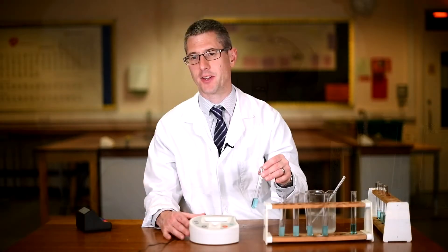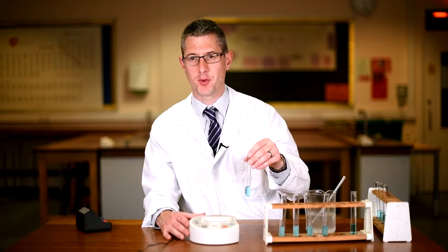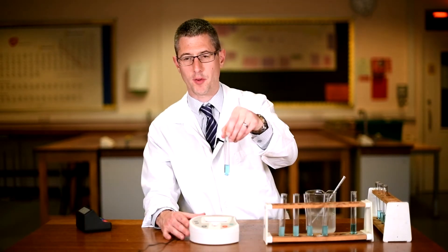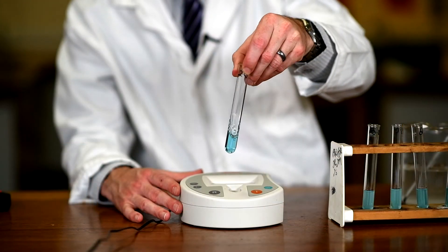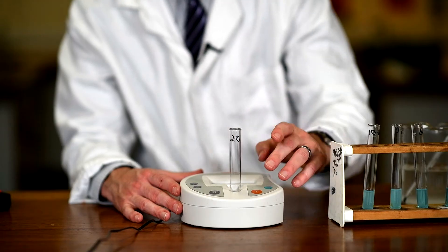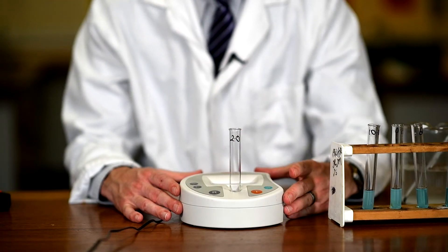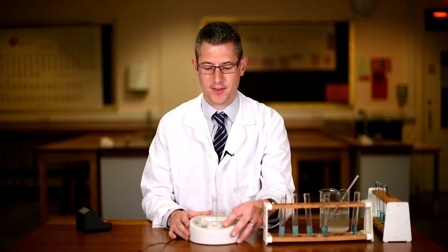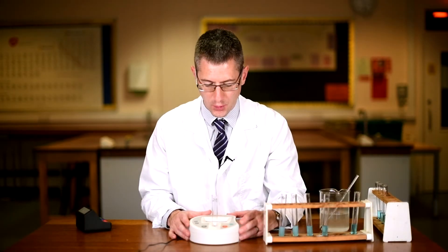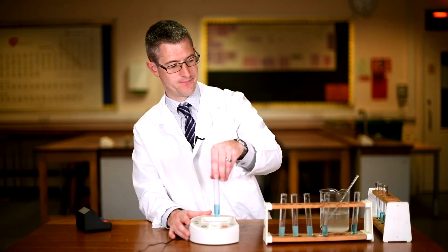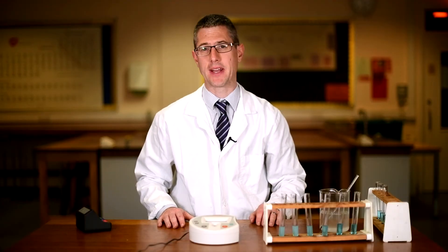So having blanked the machine or put in a reference sample, we're now going to start testing our samples of known glucose concentrations. We've got two millimoles per decimeter cubed here. Give it a little shake, in it goes, and test the sample. The two millimolar per decimeter cubed concentration of glucose has a reading of 0.06 absorbance. I'm now going to quickly take the remaining measurements.